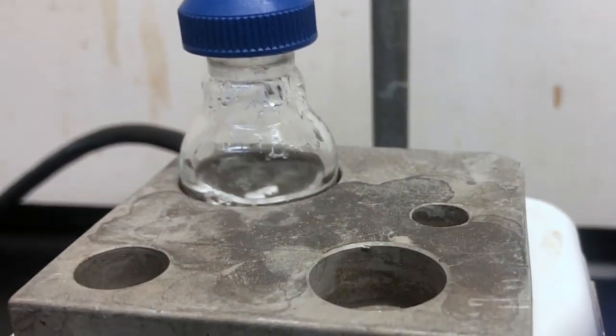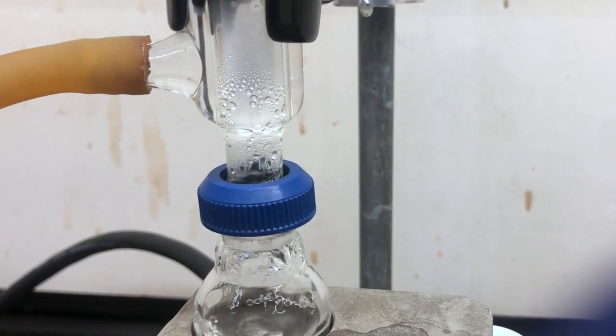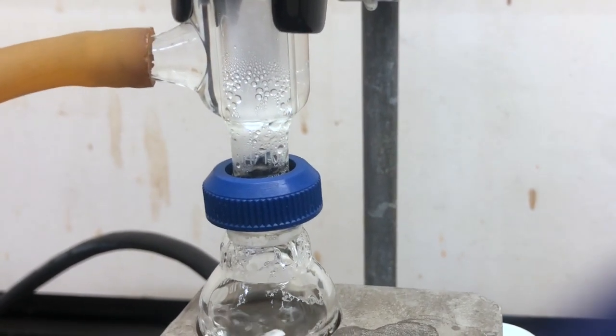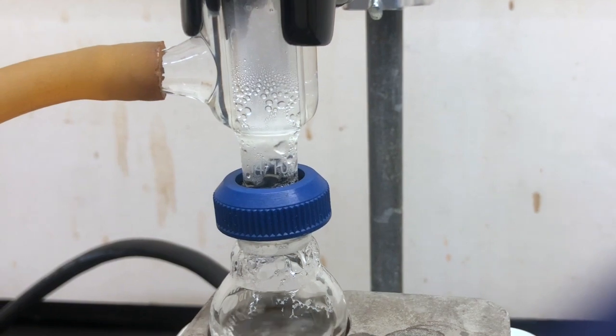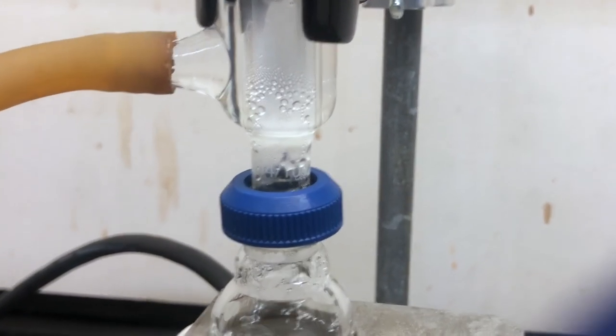Here we see the reaction mixture right as it's coming to a very strong boil. You can see the bubbles forming on the boiling stones and you can see liquid collecting in the reflux condenser and dropping back down.